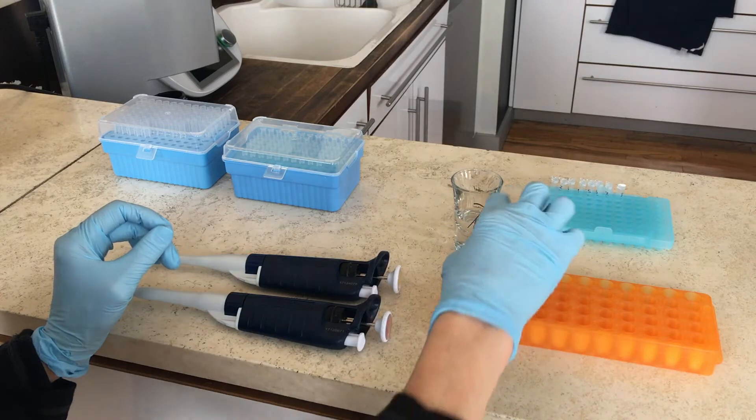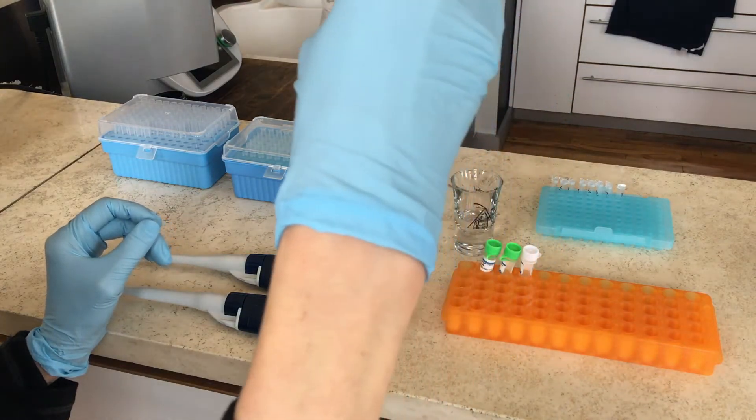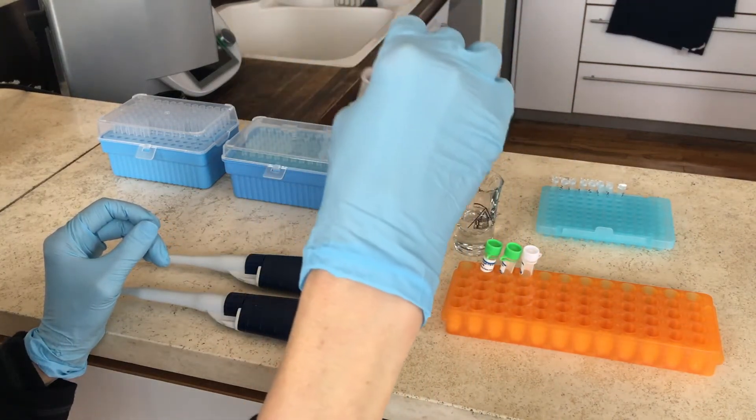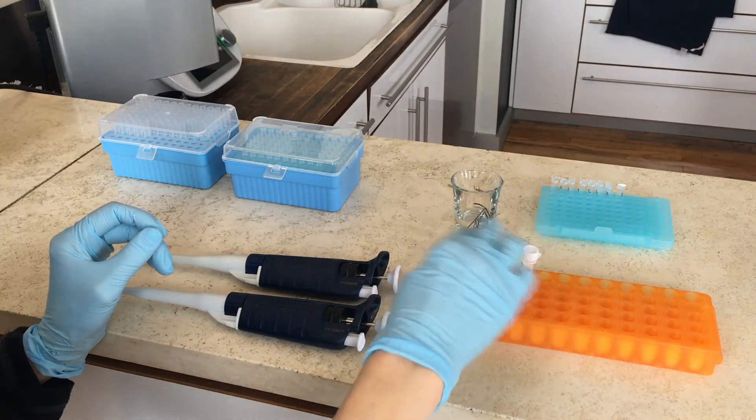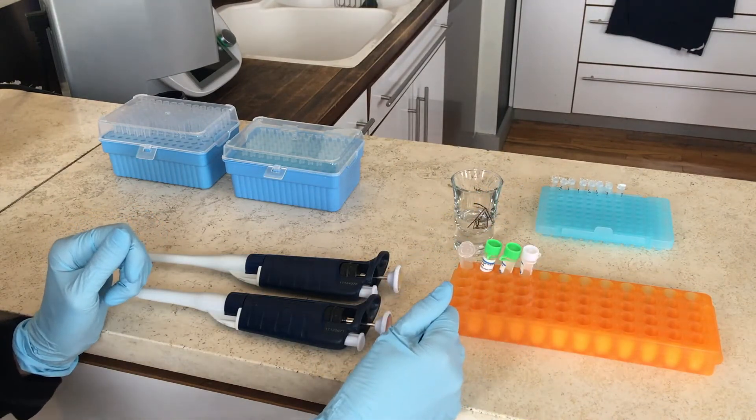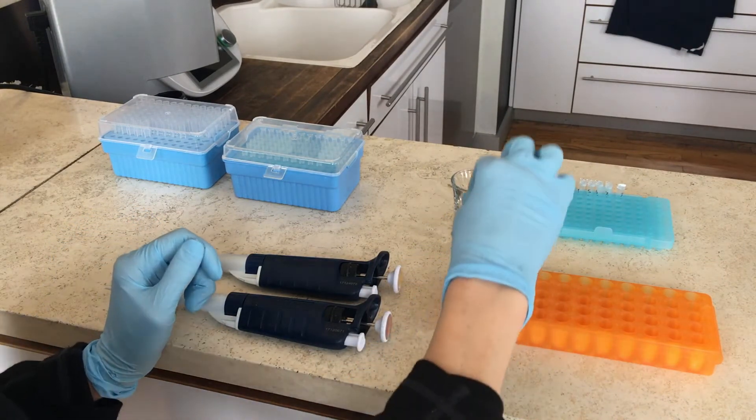I'm going to mix them all together in this tube. That's the important step. So I'm going to take a little bit from all of these and then put them all into this tube where they're going to get mixed together.